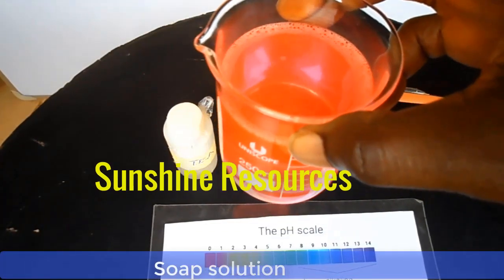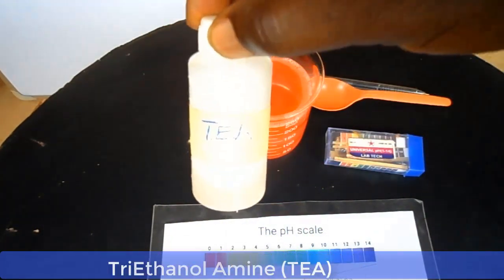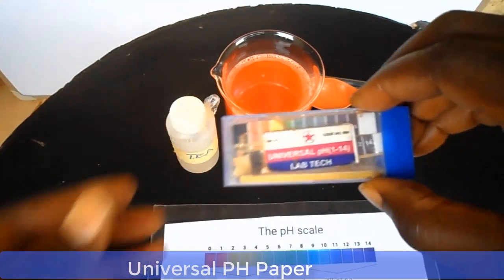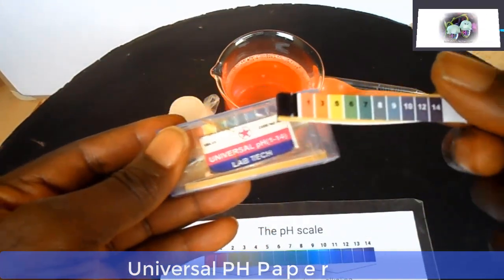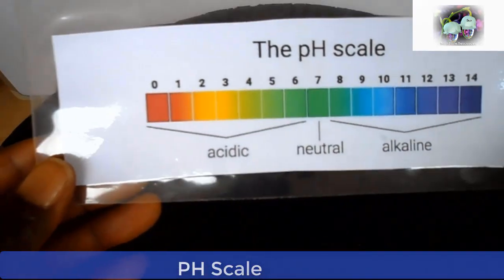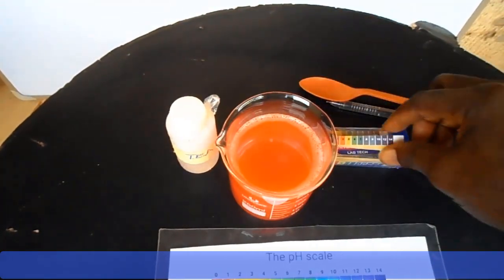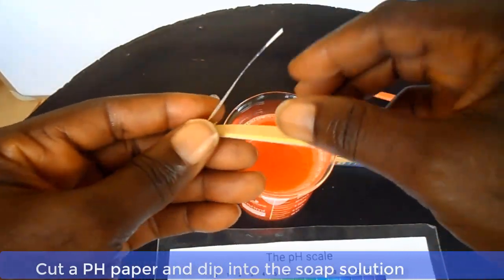Here we have a liquid soap solution. This is triethanolamine TEA. This is universal pH paper, and this is a pH kit. Now let's find out the pH of the liquid soap. Cut the universal paper and dip it into the soap solution.